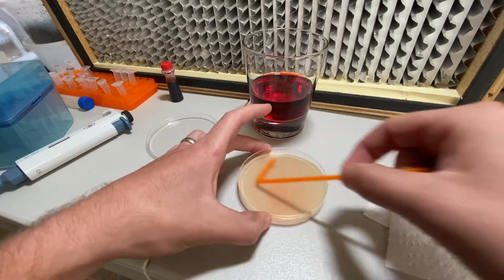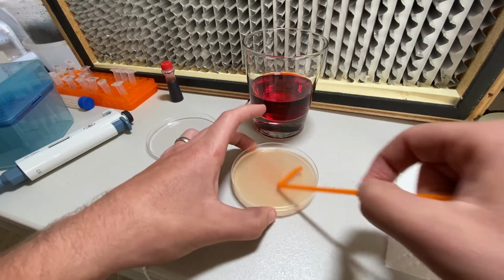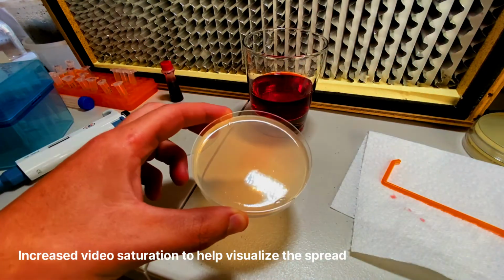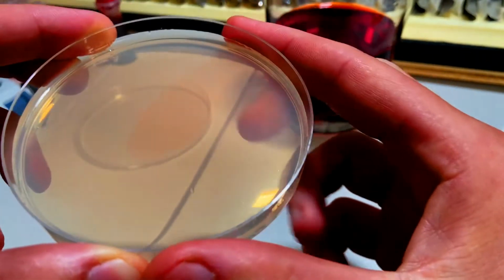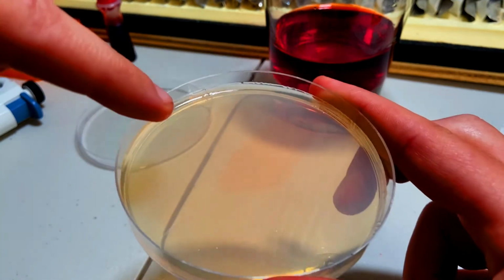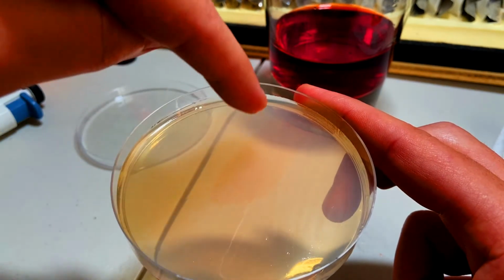Wow, this is really actually revealing a lot more than I would have thought. All right, let's take a look at that. First of all, I don't know if you can see this. See if I can get it a little bit closer. But where I originally put the stuff that I'm spreading, you can see how in just a few seconds that it had to soak in, there's a heavier amount that is soaked into the plate here.